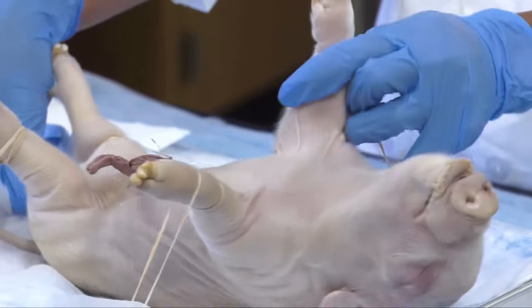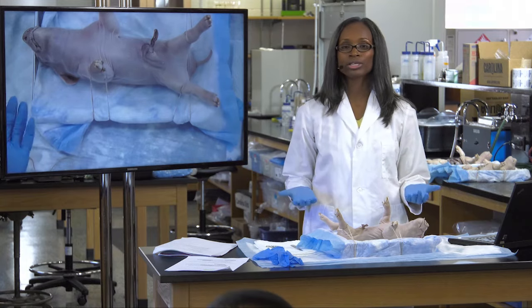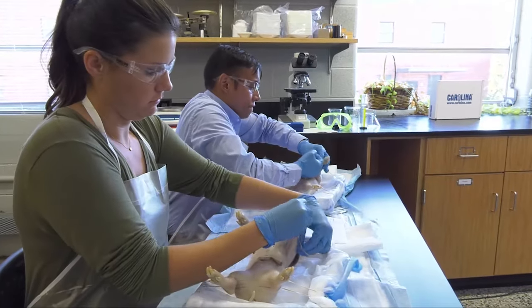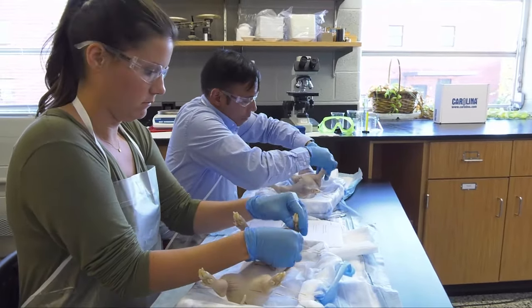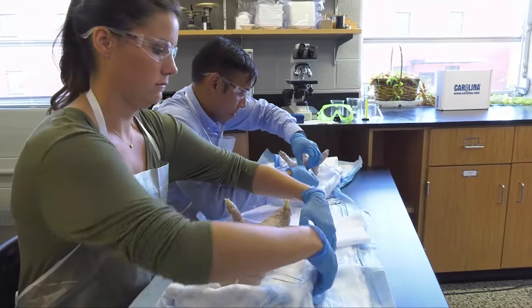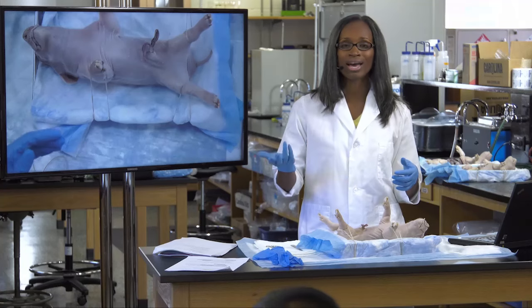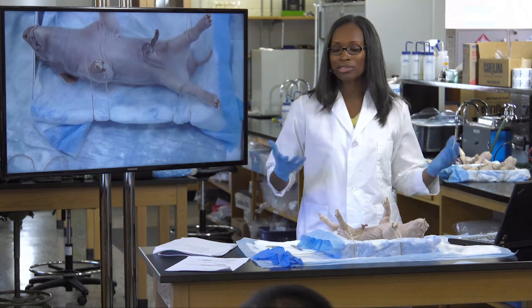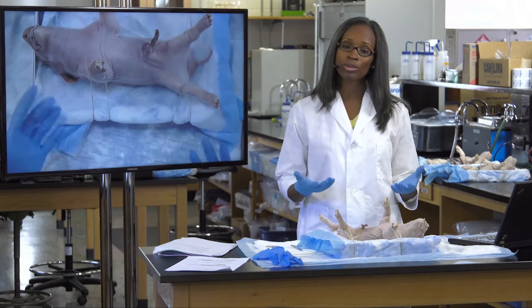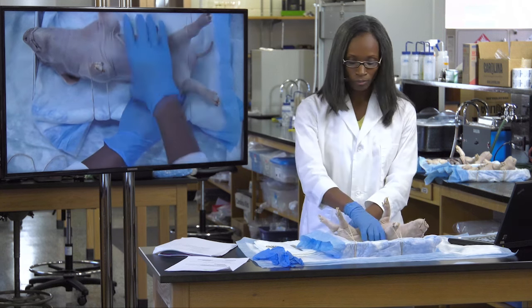In terms of classroom management, you can really divide your days up. You can spend the whole class period dealing with the abdominal cavity, assigning students responsible for cutting that day. The next class period you resume and move into the thoracic cavity. You also want to make sure you have some things to help your students self-guide through this experience, since there's only one of you. Carolina has dissection mats available that you can use as well.